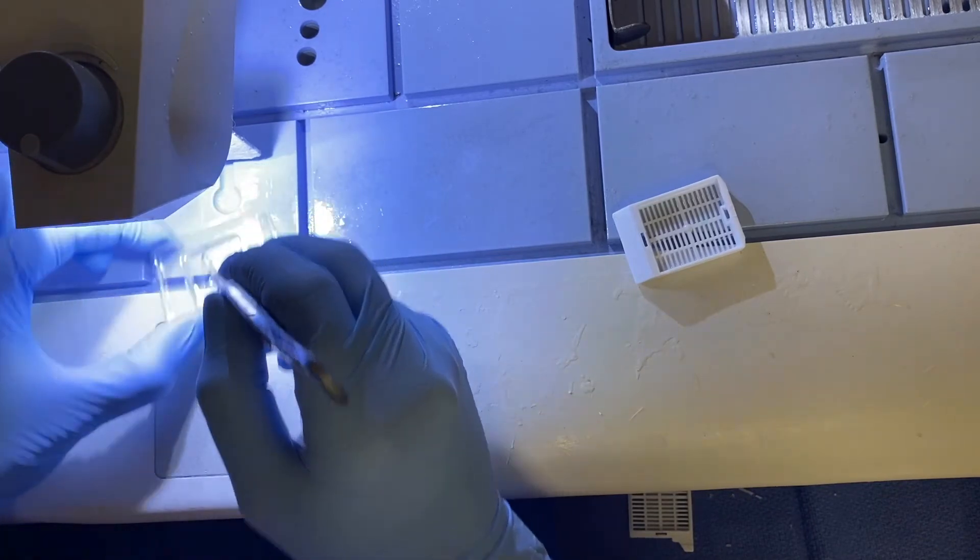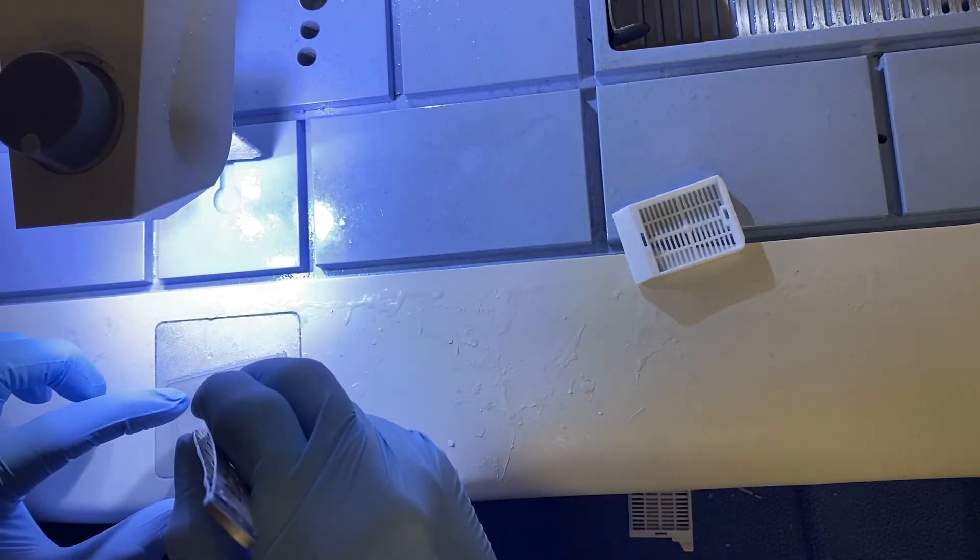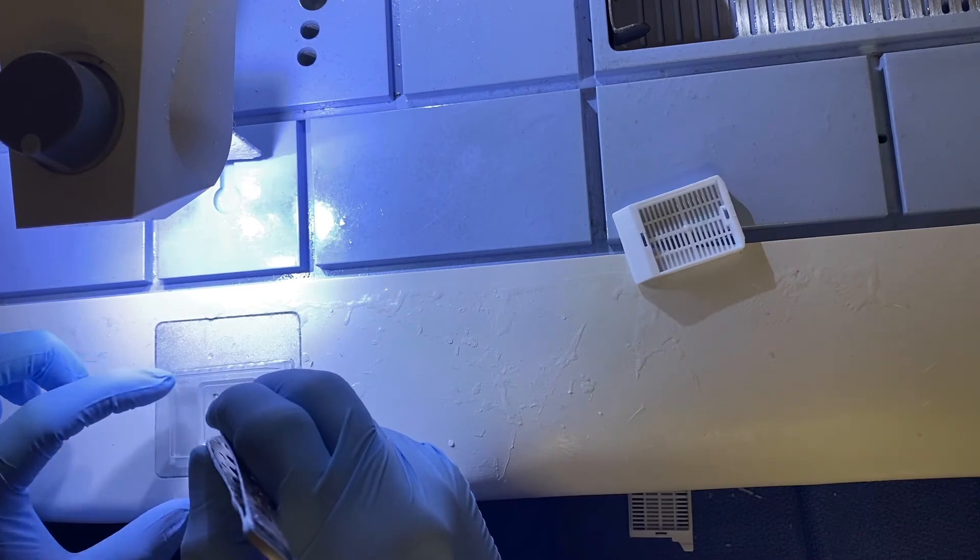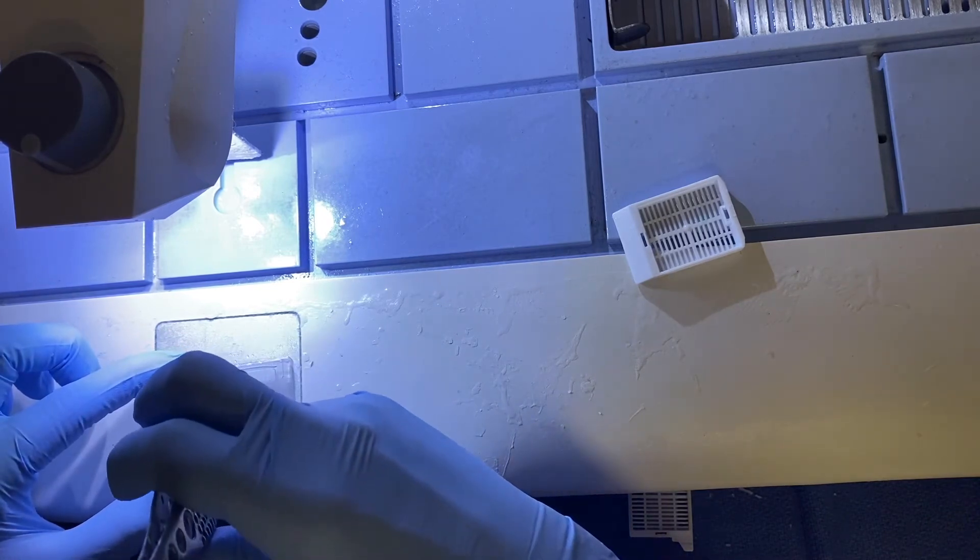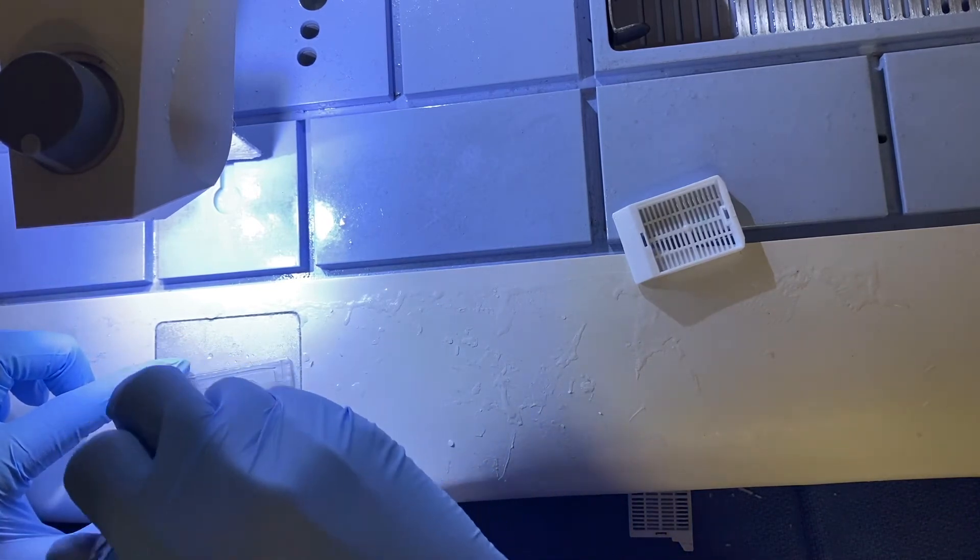Again, push it down to the bottom, put it on our cold plate so it solidifies in place. My forceps are solidifying in place as well.